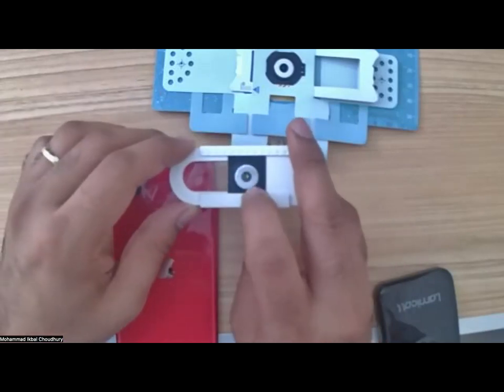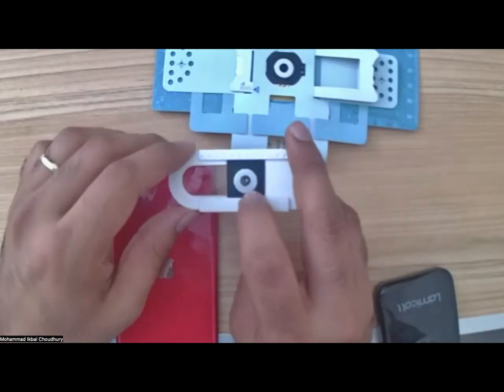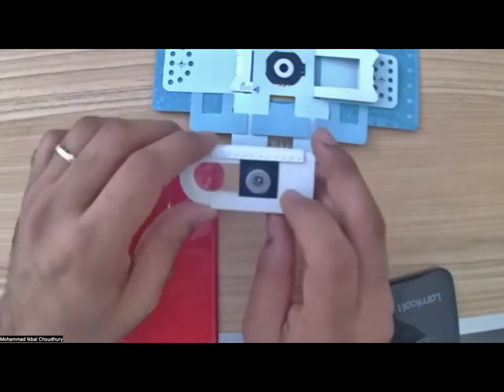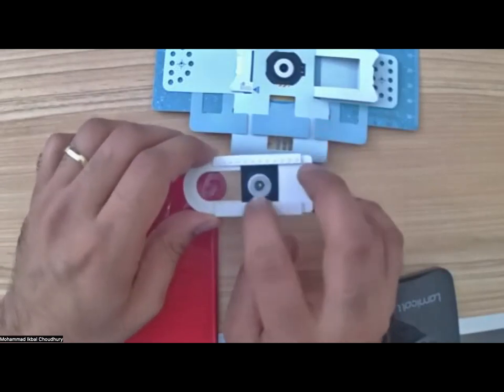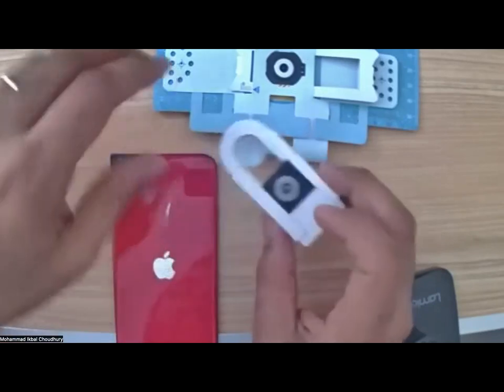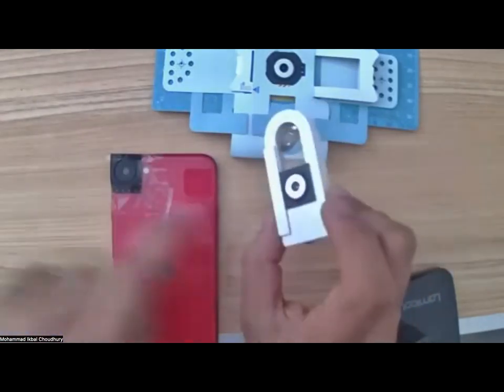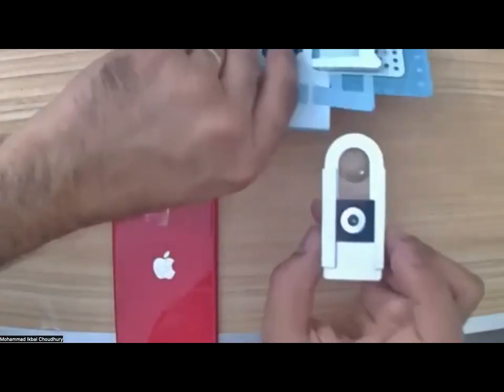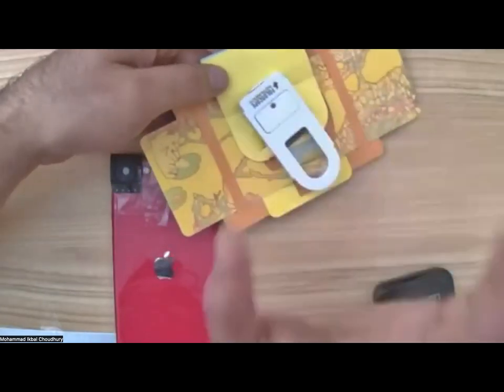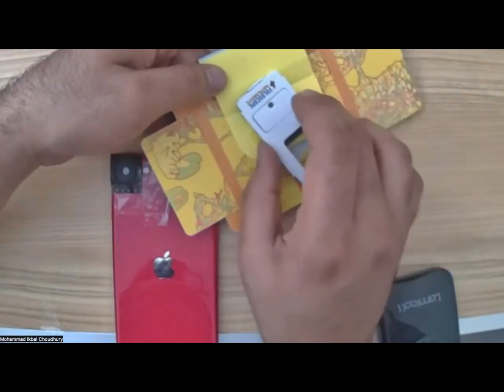So you just have to slide it. Is there a question? Okay. You just have to slide it so that it aligns with the LED light. Now, the funny thing is that it's the exact same adapter, right? So it connects to the foldscope on the other side. So if you leave it like that, it again connects, you see?